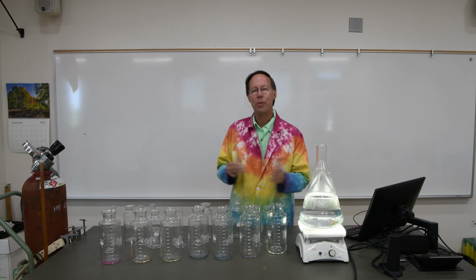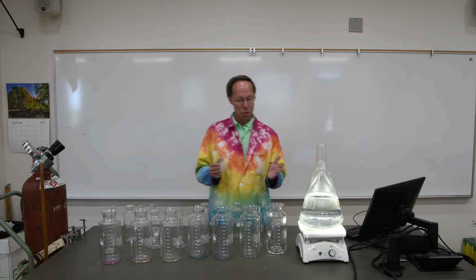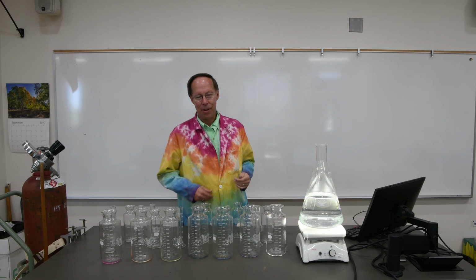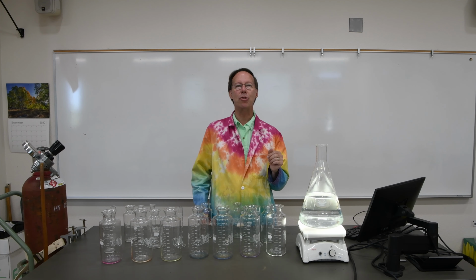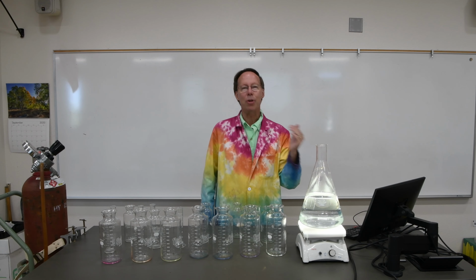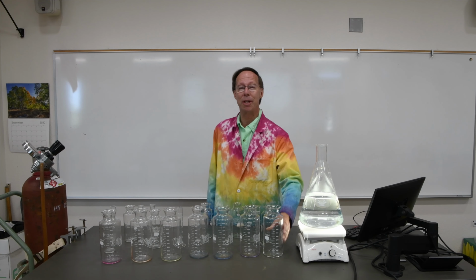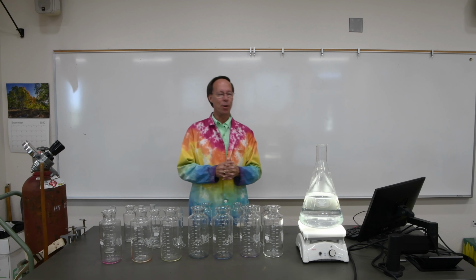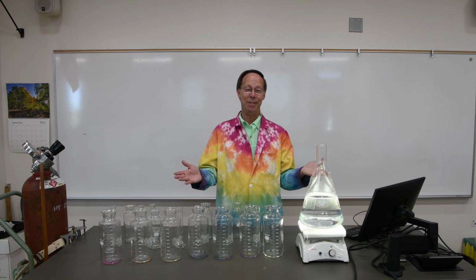Like I often do with demonstrations, I saw this demonstration years ago. My colleague and friend, Mr. Hastings, used to do this demonstration. I really enjoyed it. I added this 7th beaker just for fun. There's really not ultraviolet in there. I simply didn't put an indicator in there. Instead, I added some concentrated sulfuric acid to it so that the solution would remain acidic. When I combined the first 6 together, you could see all their colors, but then we added the so-called ultraviolet flask, which simply had a lot of sulfuric acid in it. The acid changed the solution back to acidic, and all of those 6 different indicators went back to their colorless form. When I do this for young kids, of course, we don't get into the technical part of it. They just think rainbows are fun. And who doesn't?